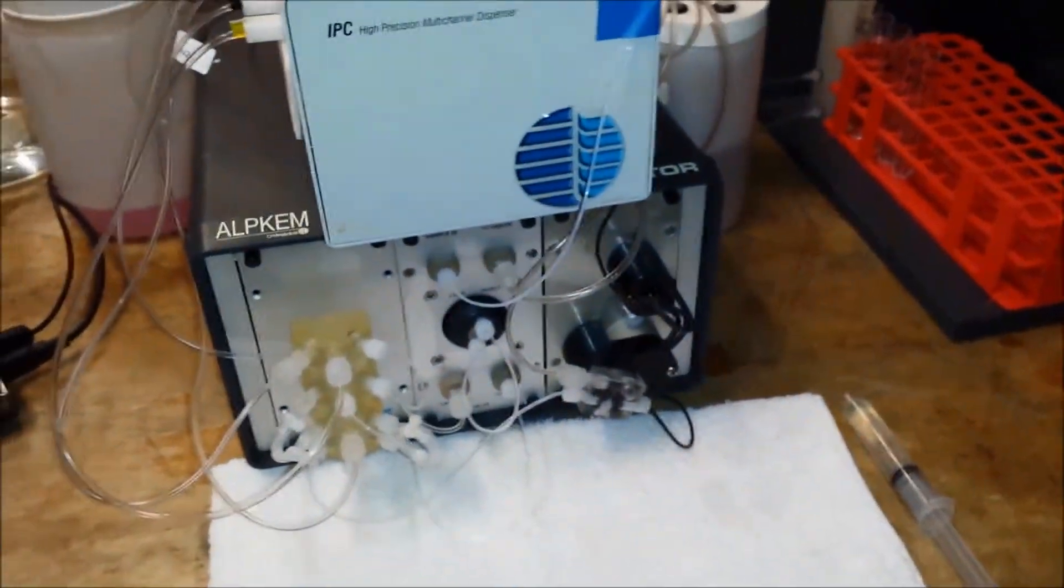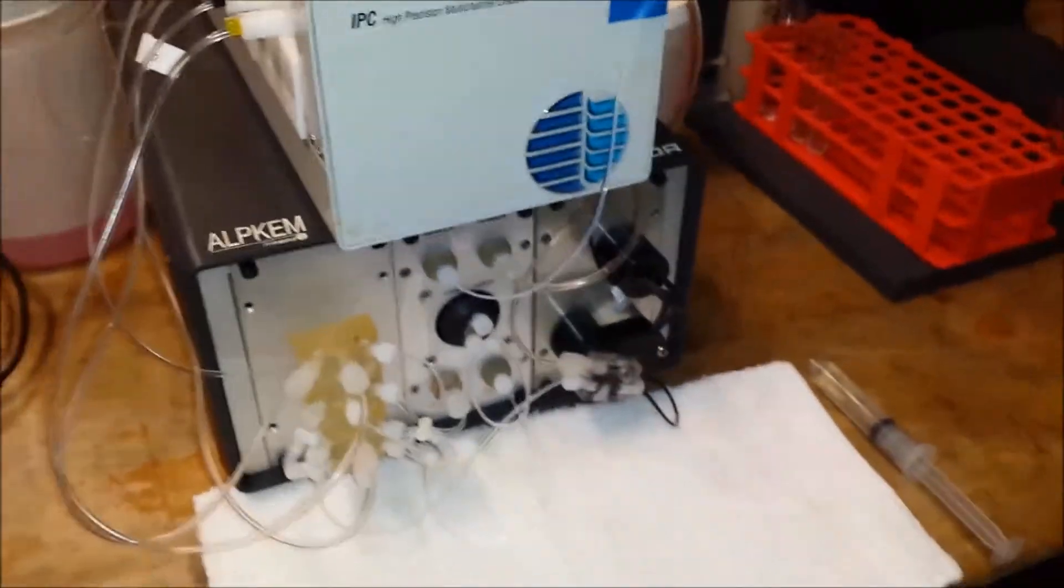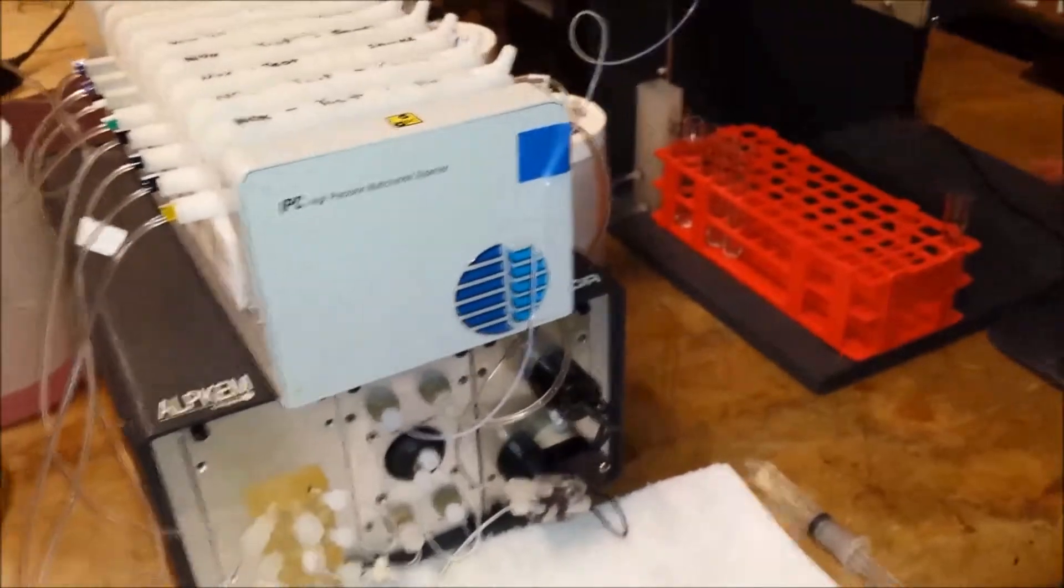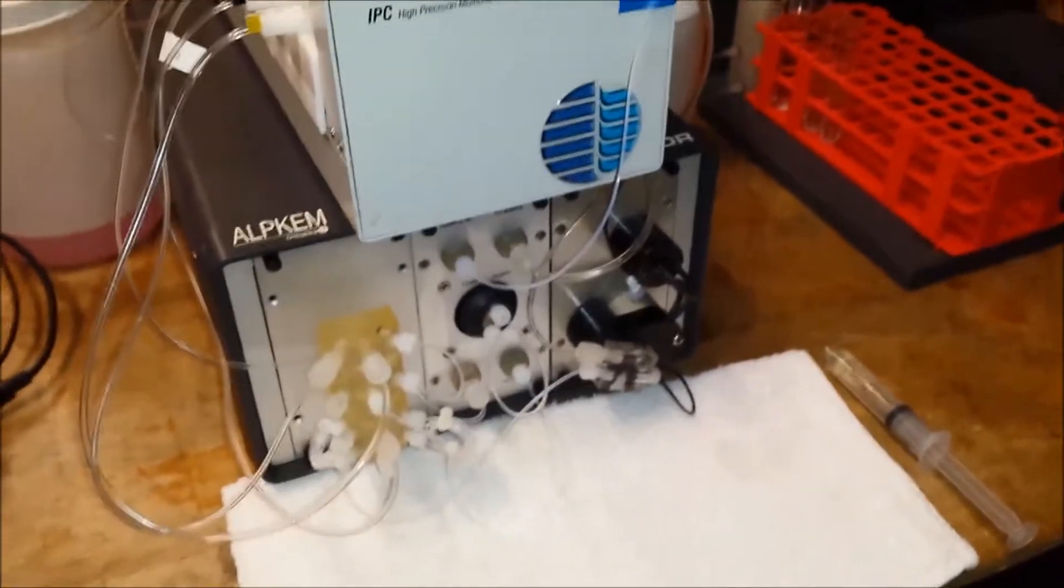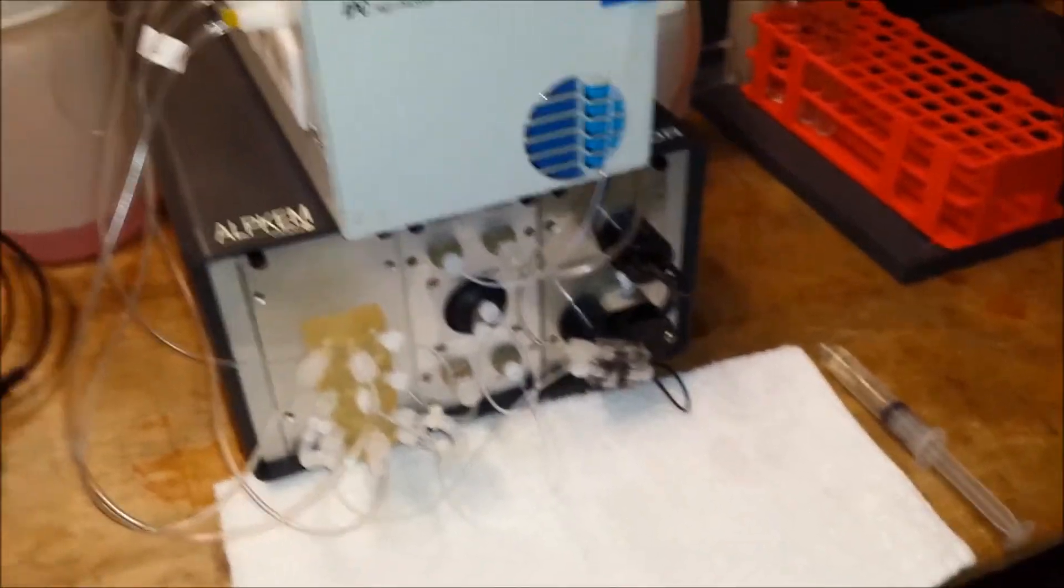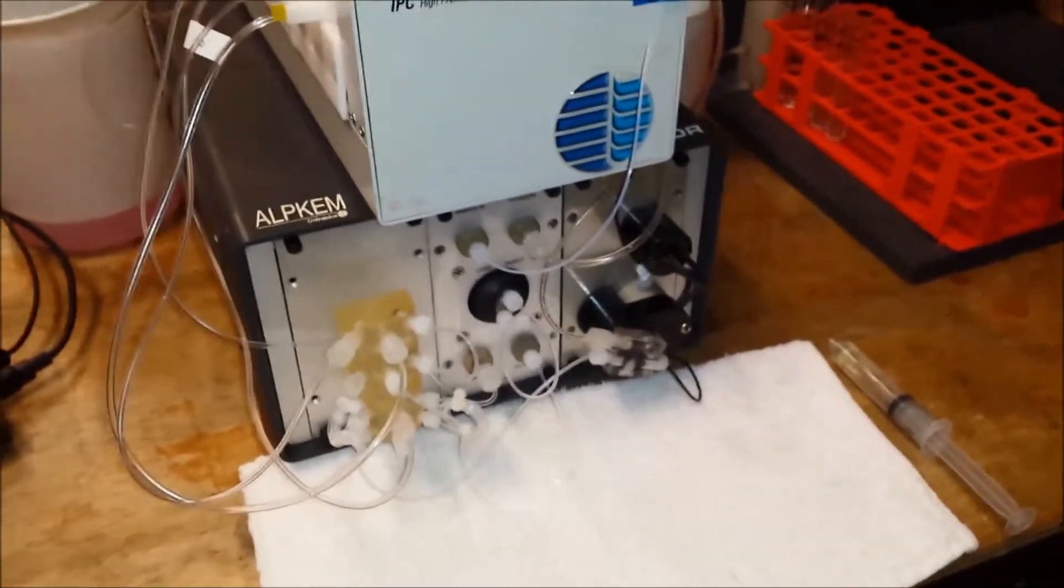Today in our ongoing series of troubleshooting with auto analyzers, we're attempting to address a problem related to no peaks. So the operator is experiencing a system where they're not getting any peaks.